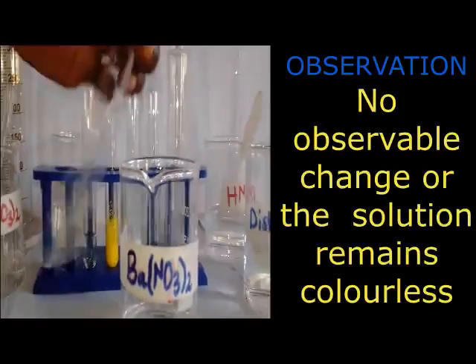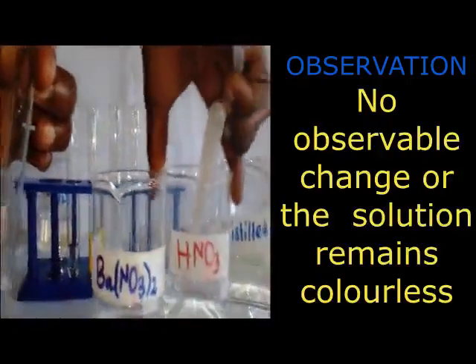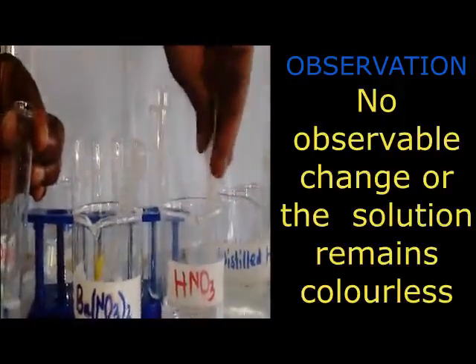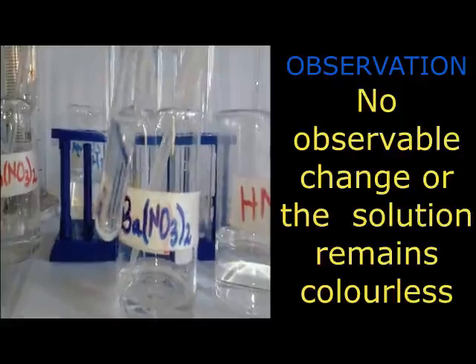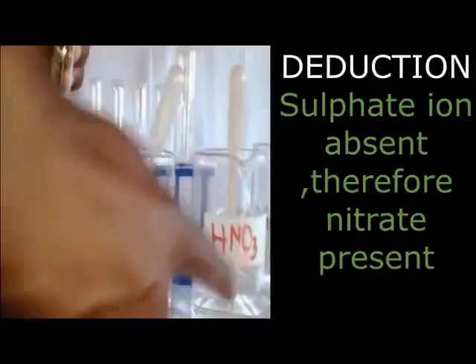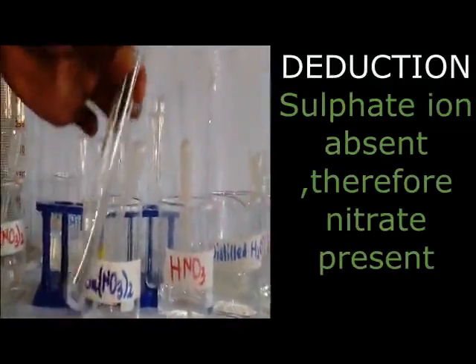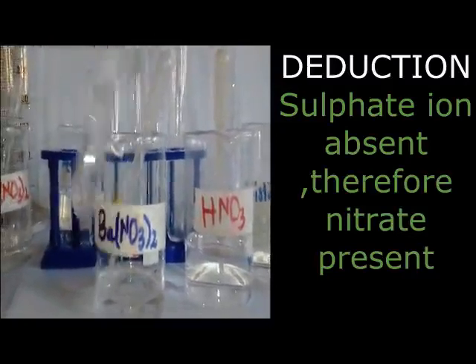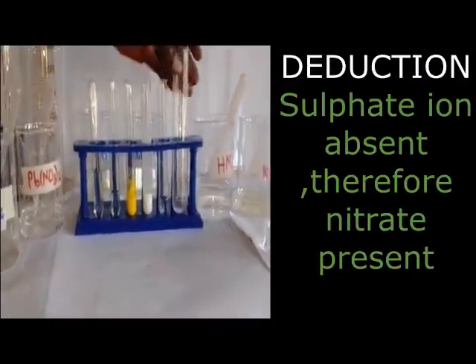Remember, as you have added one test, we divided into 4 portions. So now I have added another portion, the fourth portion. Now we add the barium nitrate, no observable change with nitric acid. What are we going to record? We are just going to record that sulfate is absent. Sulfate confirmed absent. We can now still stand on our nitrate. Sulfate absent. Nitrate present. Now this implies what?